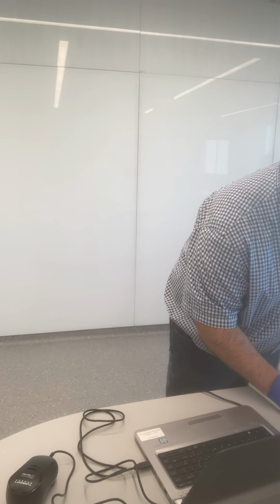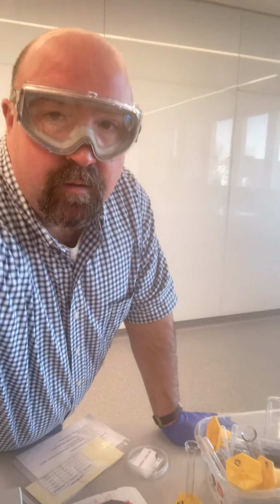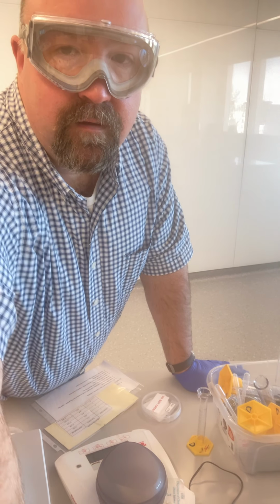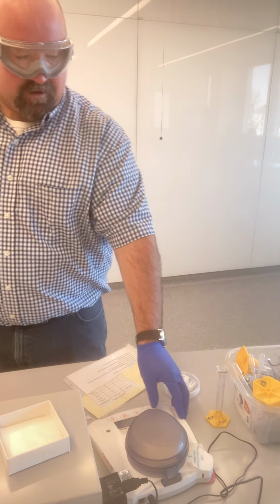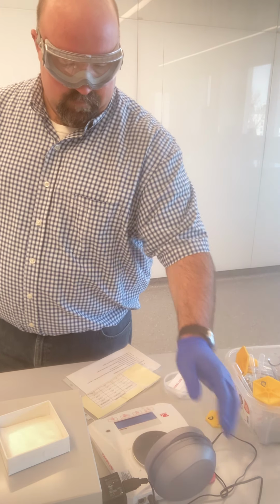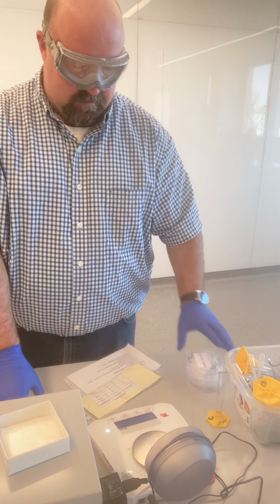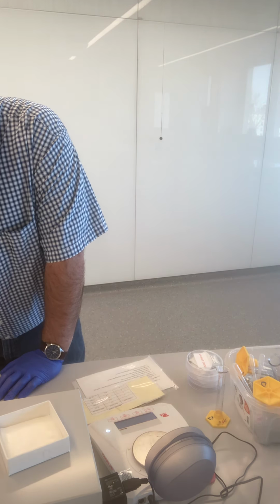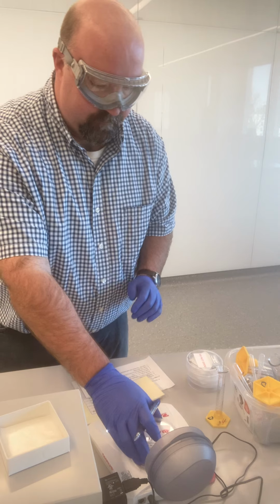So my TSS, total suspended solids. I'm just going to move our camera. I should have set up over here to begin with, but so that you can see, I'll tilt this a little bit so you can see the balance. Again, I'm just using a balance in order to take our mass. I'm going to turn it on, let it get ready to go, and I'm going to zero it, and I'm going to find the mass of sample spot 1.